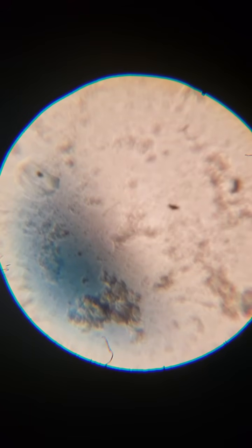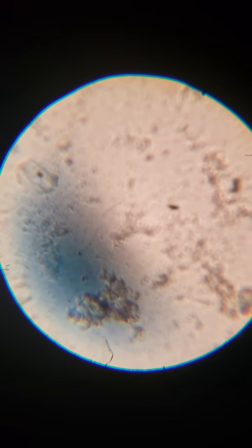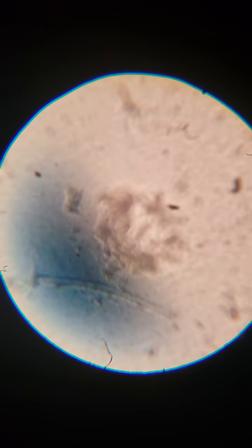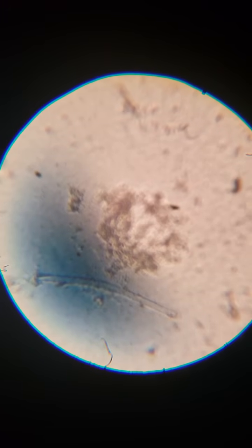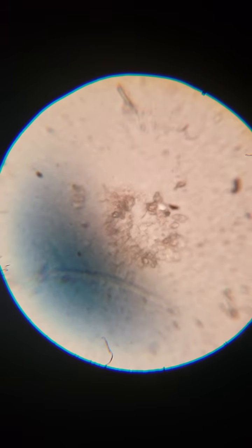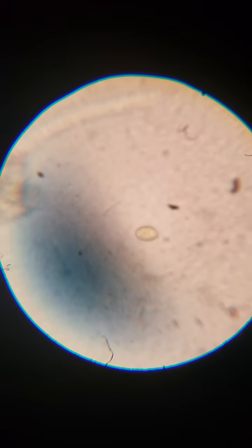Then lastly, we're going to hop over and look at bacteria. So this is good bacteria that turns the nitrates, or creates nitrates from nitrites and from other things. There is actual fungi mixed in with it here. There's like little spores and other doodads in here. There's even plant cells you can make out, like green plant cells and debris. But what this is, it's my filter floss emptied out.